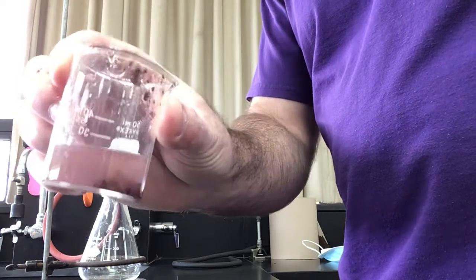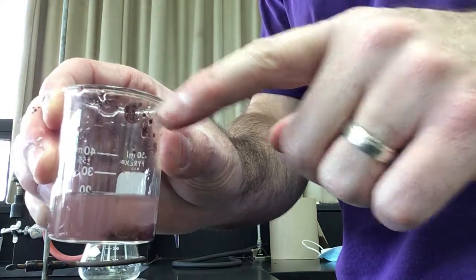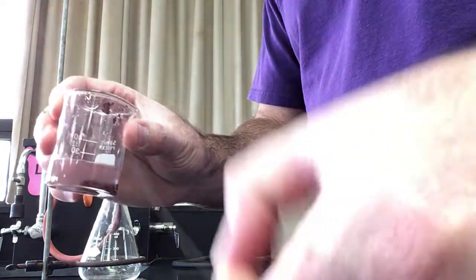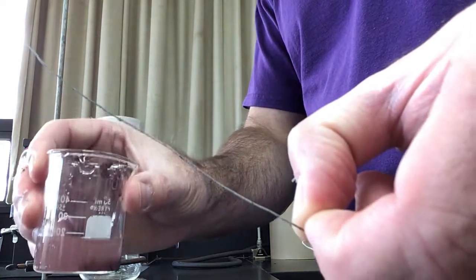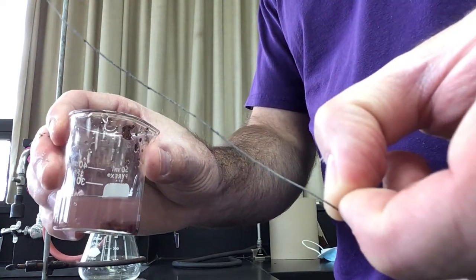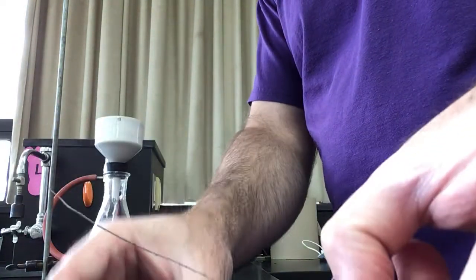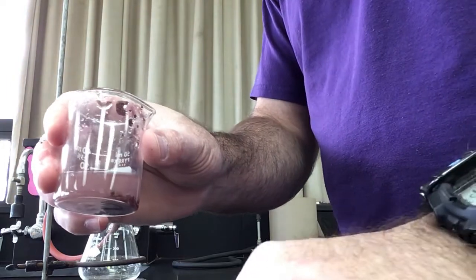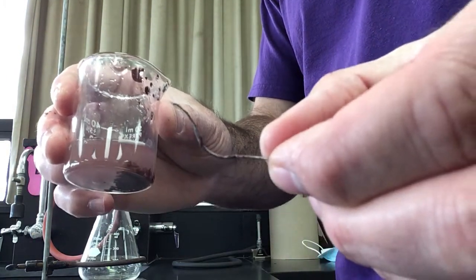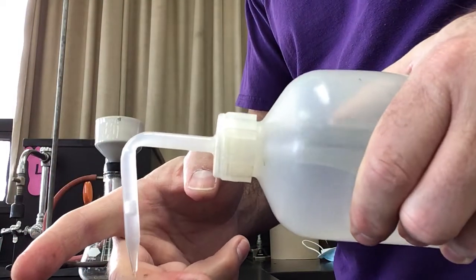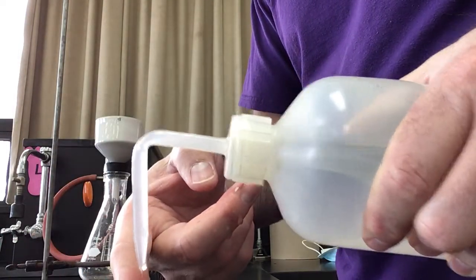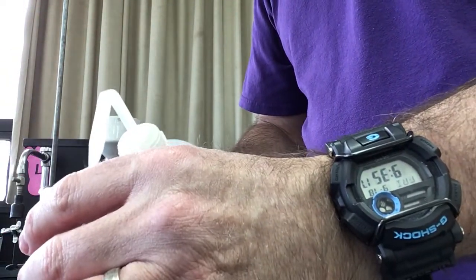I've got a lot of our copper off here kind of sitting on the bottom and on the beaker itself. This is a bit of the aluminum wire that was left in there, it actually sort of formed around it and stuck to it. I actually had to use my fingers to kind of try to scrape it off there, which isn't really great lab technique, but I kind of knew the solution itself wasn't super harmful. I had a little copper on my finger, so I just rinsed that off into the beaker there.